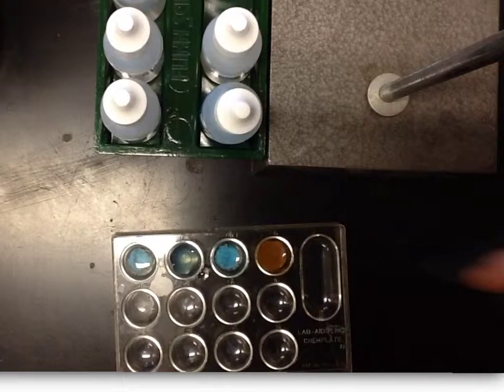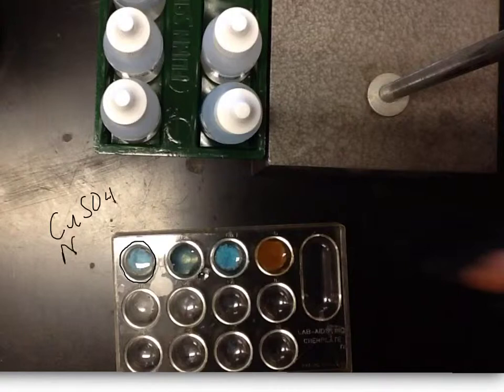Okay, so to point out then, this is our first well. We said that these 2 chemicals produced a new chemical. So in that one we had copper sulfate, and I hope you can see this over here, that's CuSO4, and that is going to react with Na3PO4. If you're following along on your lab sheet, that would mean the ones that are in bold, and that would be the PO4, so I'm going to circle that one, and it's the copper. It's telling you on the lab sheet that it's those reacting, it's not these.